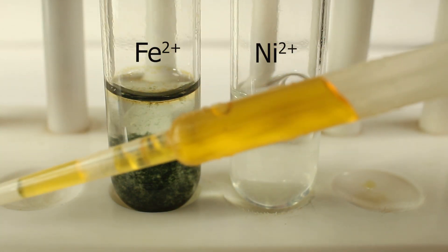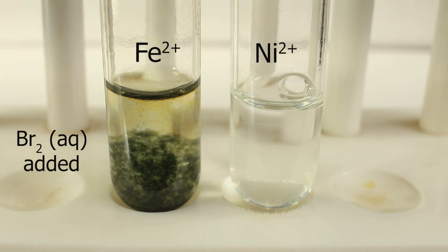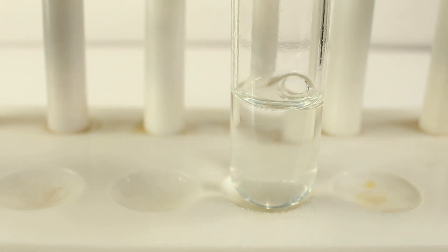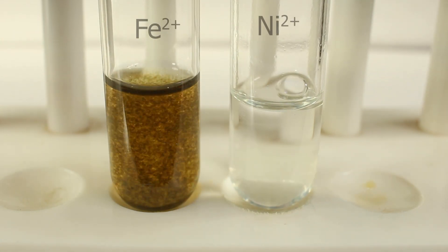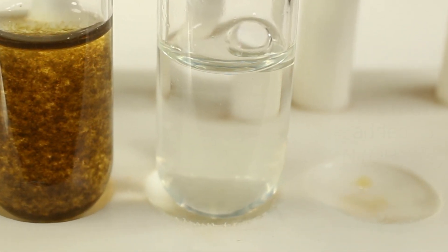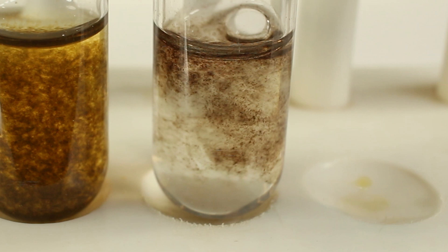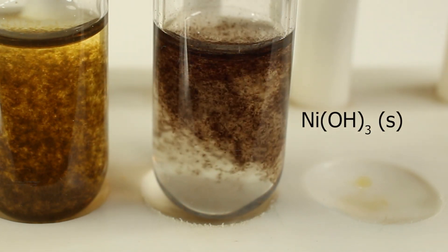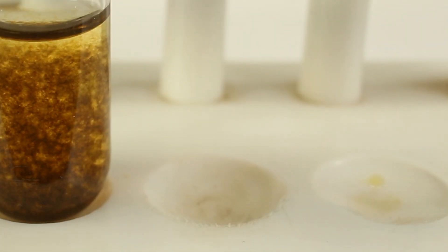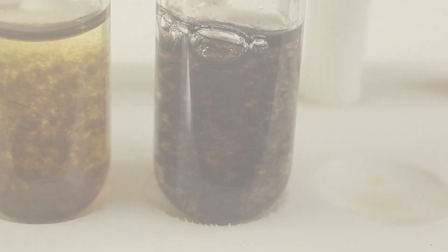Addition of bromine water is the final punch here. Bromine is an oxidizing agent — it would oxidize iron-2 into iron-3, and nickel-2 into nickel-3. Iron-2 green changes into iron-3, making a brown precipitate. For nickel-2, a black precipitate of nickel-3-hydroxide is formed on addition of bromine water. So from pale-pale green precipitate to black precipitate — that's our characteristic test.